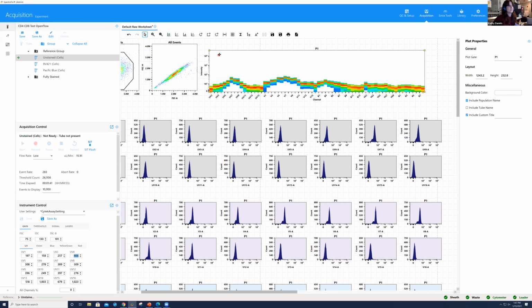But for most cases, if you have signal that's off scale, say for DAPI, that's a culprit that comes up quite often. People stain their cells for viability with DAPI, and they're very, very bright off the UV and the violet. You wouldn't want to make changes to individual detectors and bring them down, but rather choose the appropriate laser and reduce the gain by a certain amount for all of the detectors off of that laser line, okay? That preserves the spectral signature and brings it down as a whole, as opposed to changing the spectral signature to bring down the individual detectors, okay?